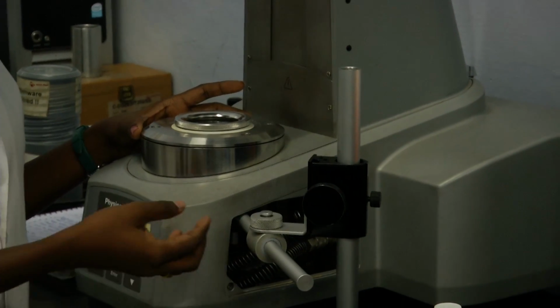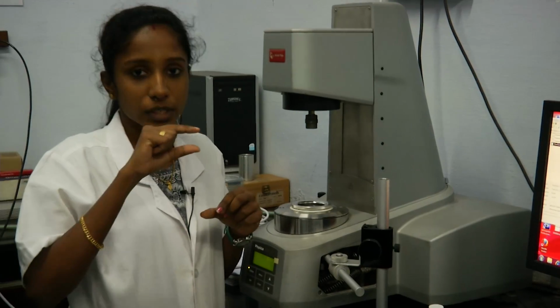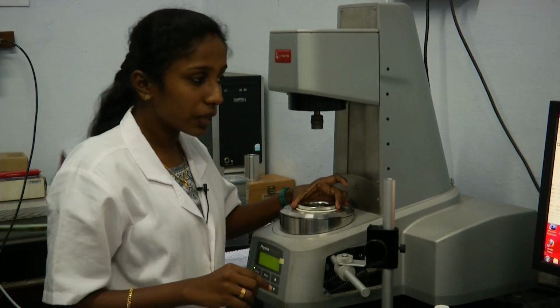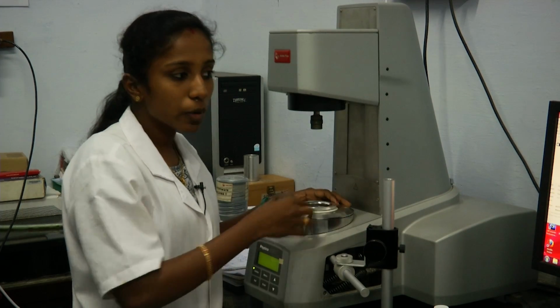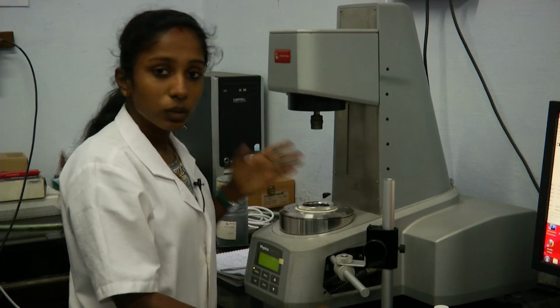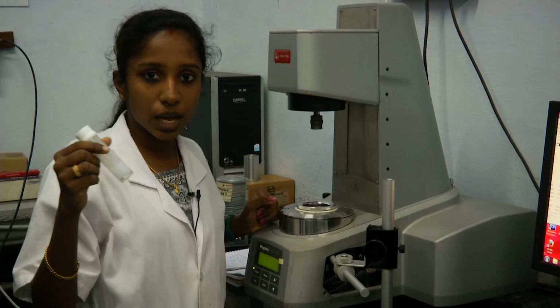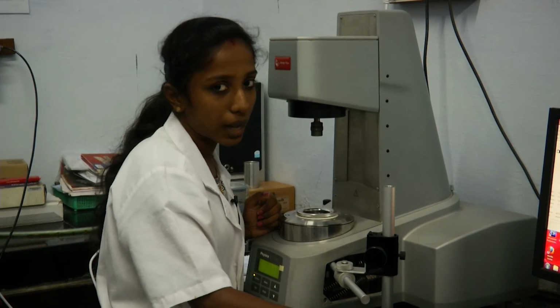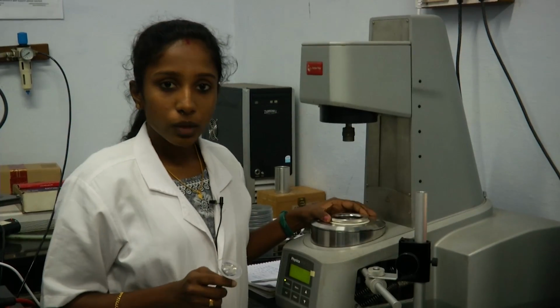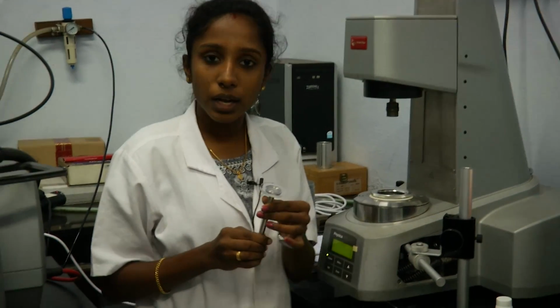It has a camera attached to that. So there is a camera on top of which there is an objective lens of the microscope which focuses on this sample, and whatever it captures will be projected on the screen. So let us now load the sample and do a steady shear test like this. Now let us load this emulsion sample and let us see what will happen to the sample as it is getting sheared. So for rheomicroscopy, we need a glass Peltier, and also we need a glass geometry.